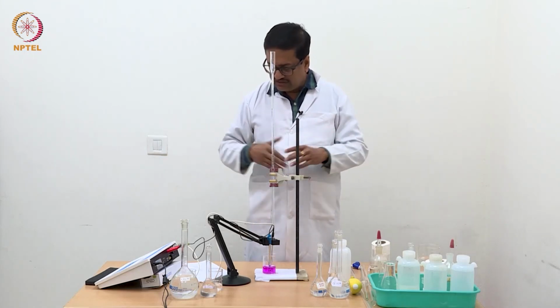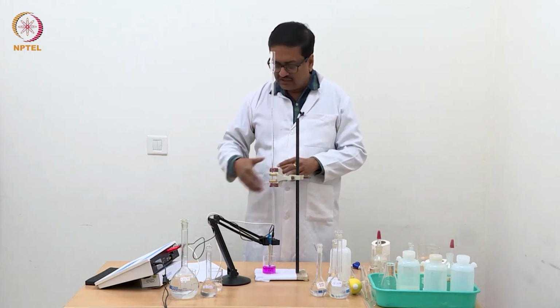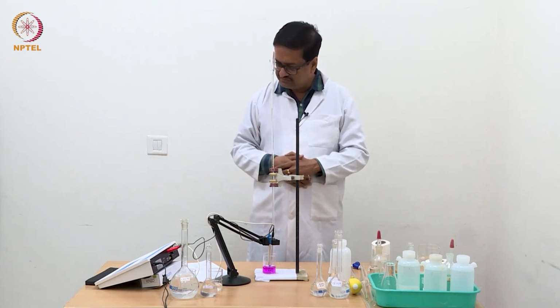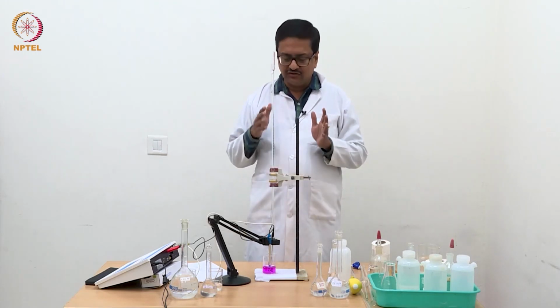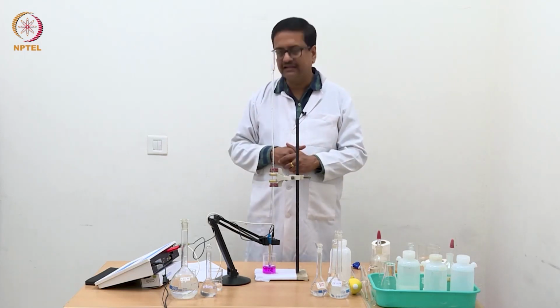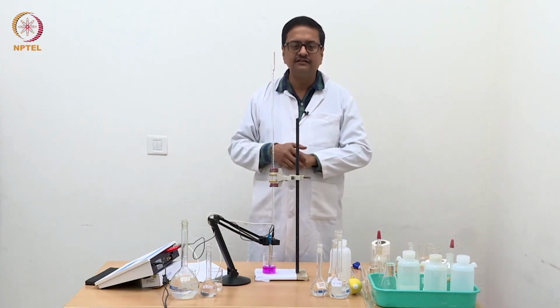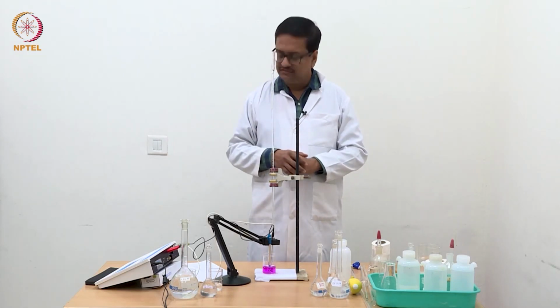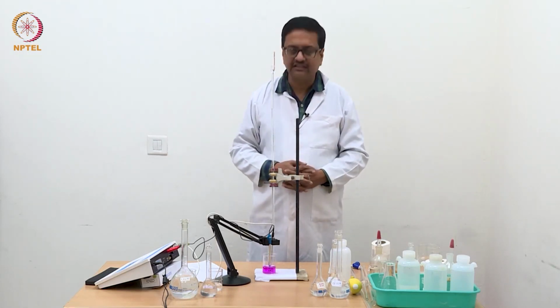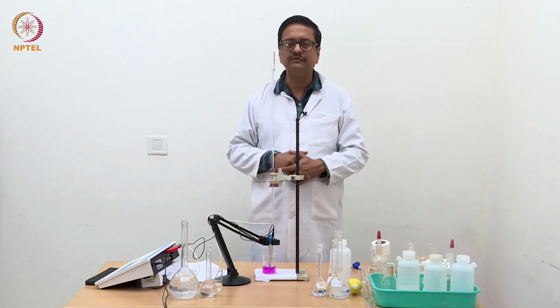So in the next class, when we discuss the theory part of it, I will show you the plots of these experiments, how to do the graph plotting, and how to get the final concentration of HCl using the plots. So I conclude here for this experiment.